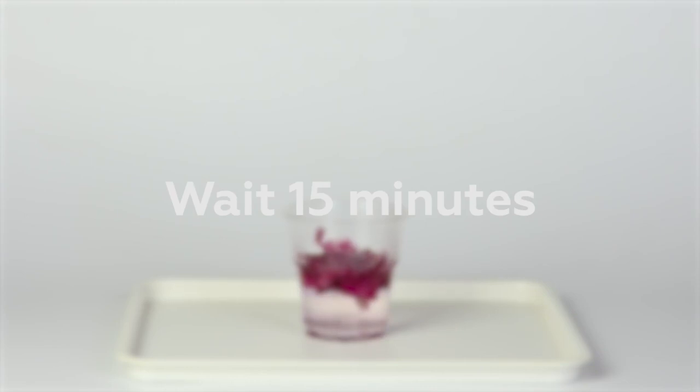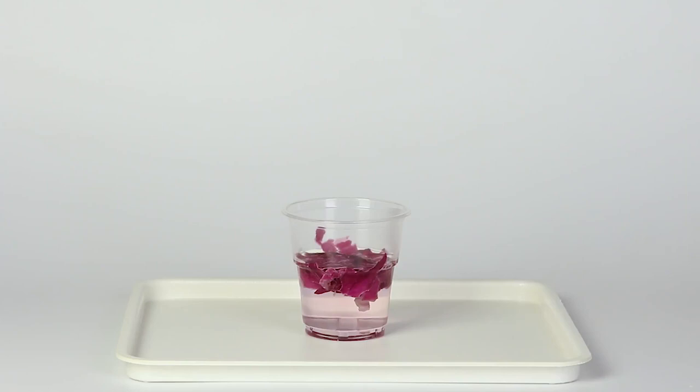Wait for 10 to 15 minutes. During this time, the anthocyanins in the petals will be dissolving in the water and coloring the solution.